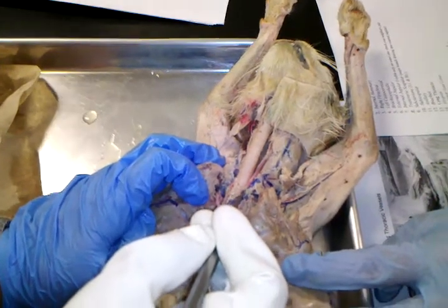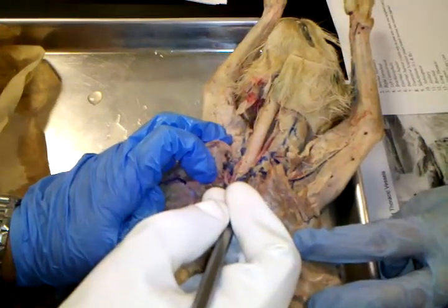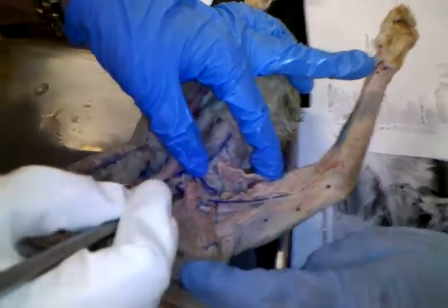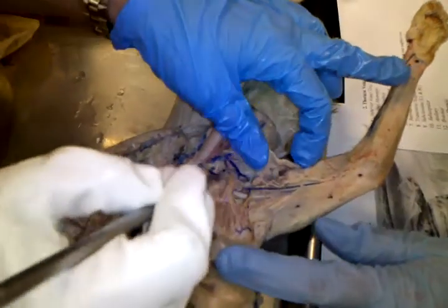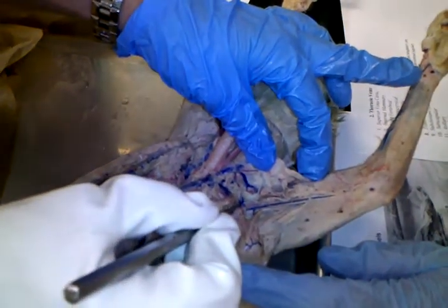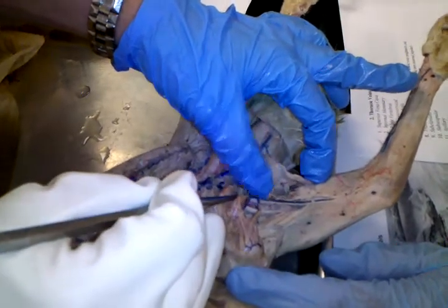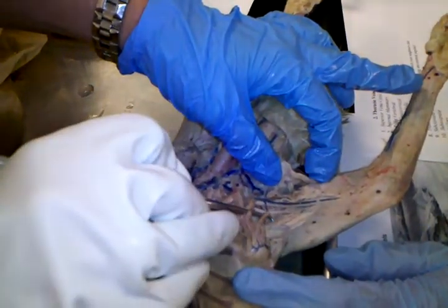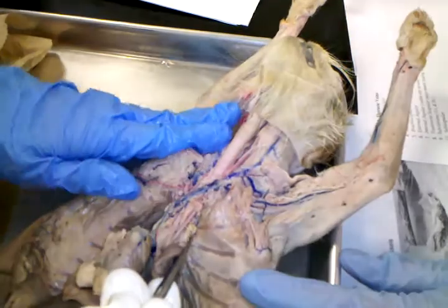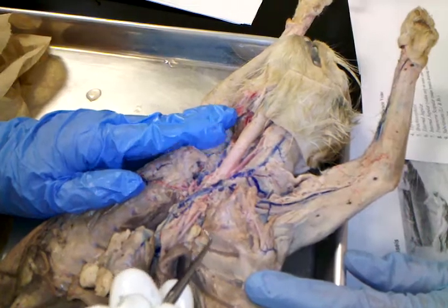Mm-hmm. And then once you pass subclavian, okay, so subclavian here. And then from there, coming off of this, you're going to have this big vessel that goes under the shoulder, just like the artery. And that big vessel is the one called the subscapula. Once you pass the subscapula, it changes to axillary, just very briefly. And then when you pass up one other big branch and it moves into the arm, it's called brachial. Now, there are 2 things I left out that you have to know. Those are the number 3 and number 4, the right vertebral and the left costocervical.